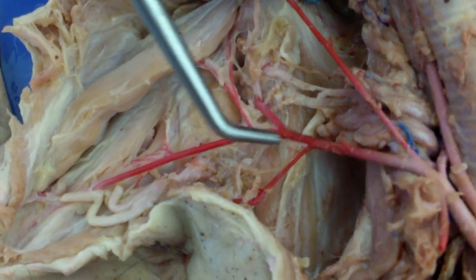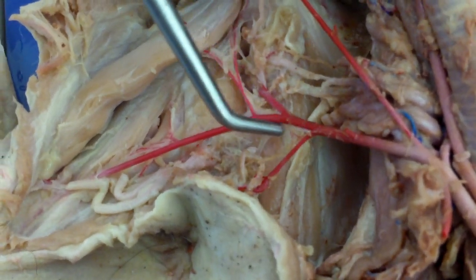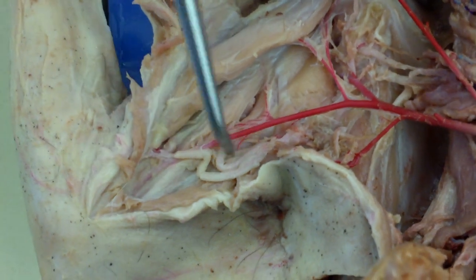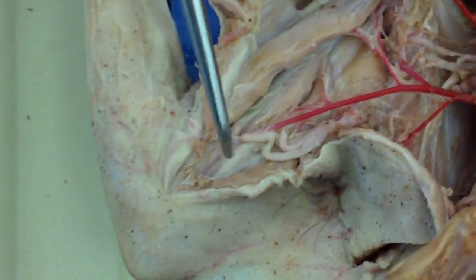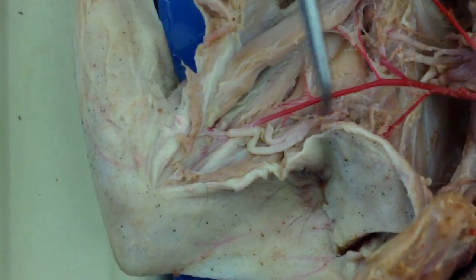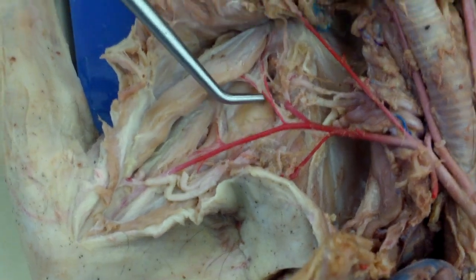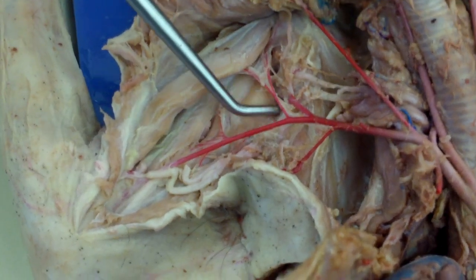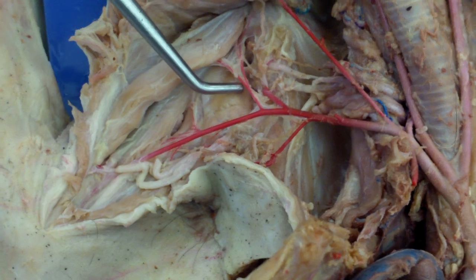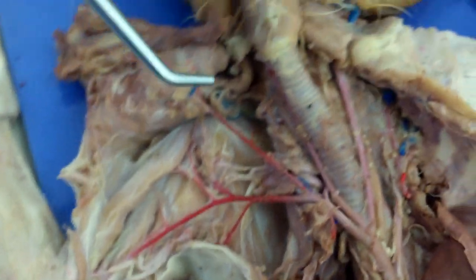Continuing, this turns into the axillary, which turns further down into the brachial — which is more towards the arm versus the armpit. And then here we have the subscapular. So that's all above the heart.